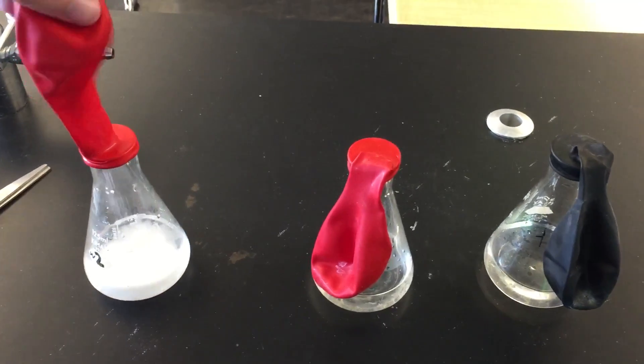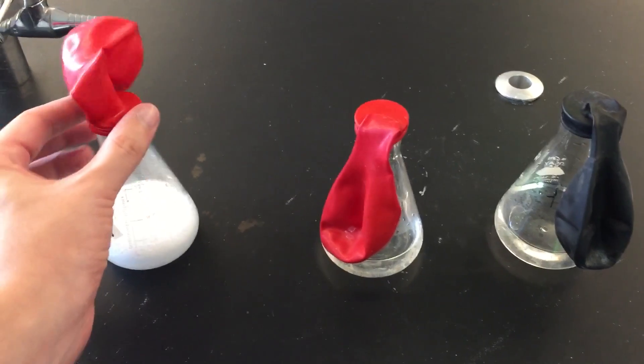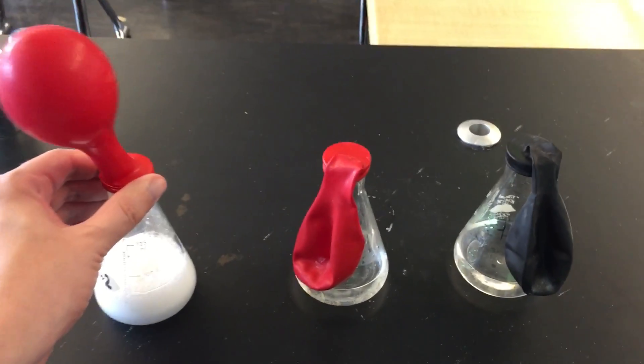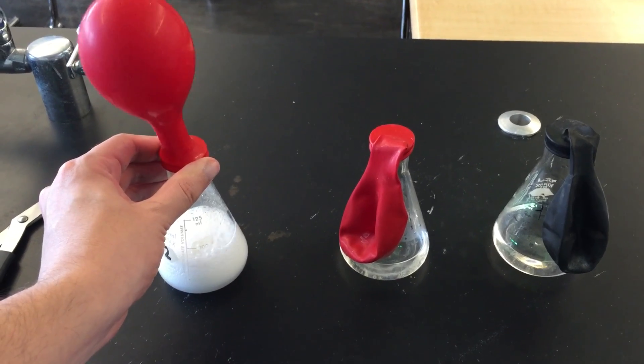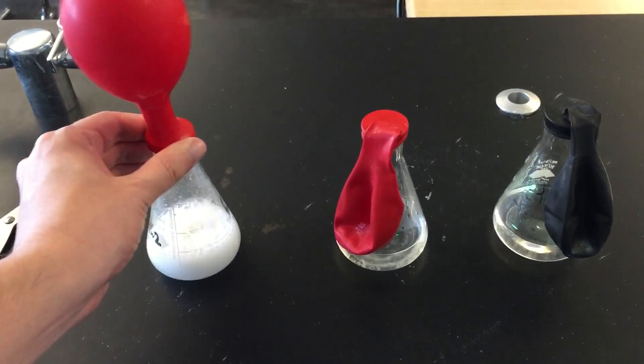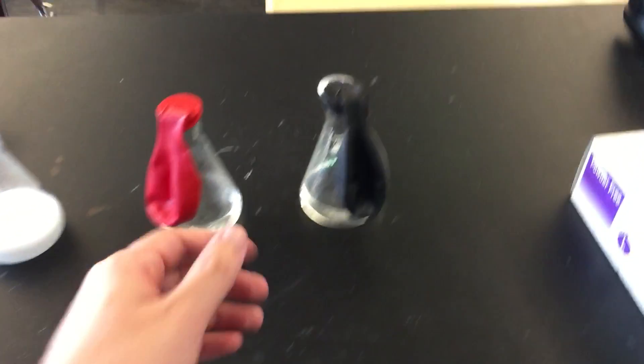So here is our first reaction. Move it around, kind of see what happens. And it normally takes at least a couple of minutes for the reaction to stop.